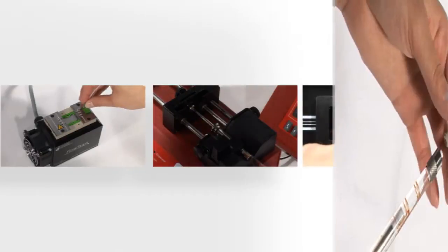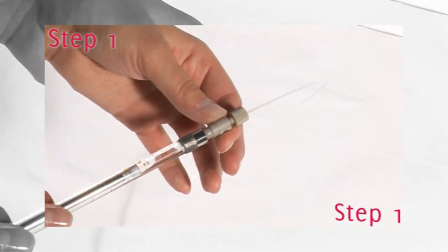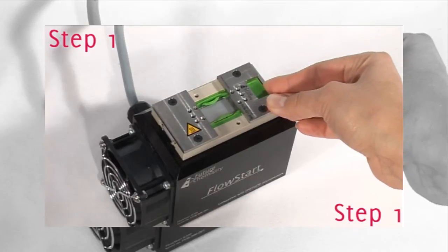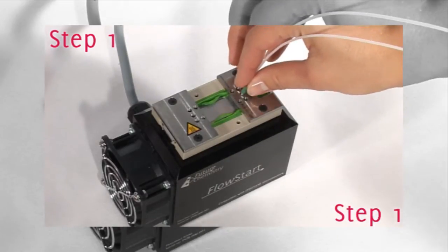In the first step, all fluidic connections are prepared. The micro reactor is simply placed into the holder and fixed by connecting tubes to the micro reactor.